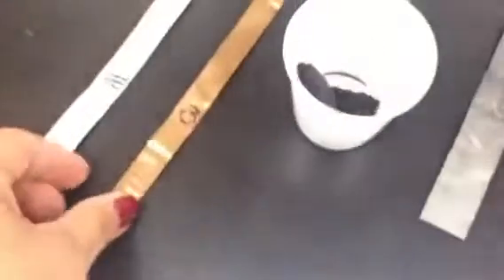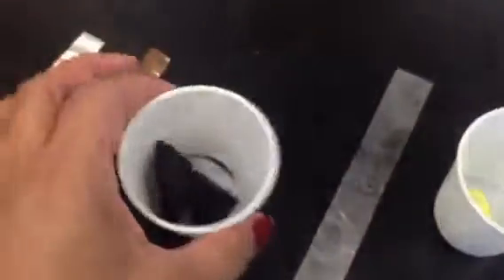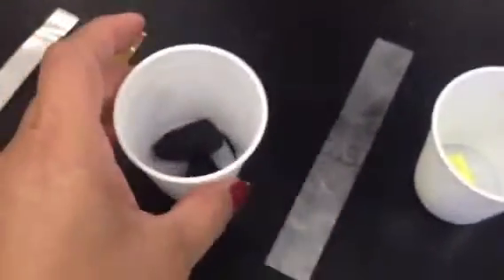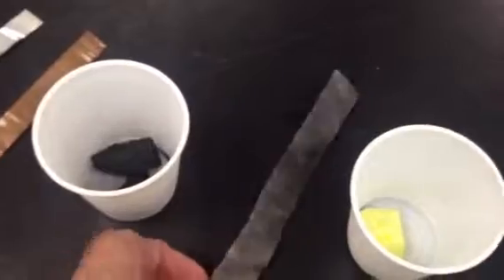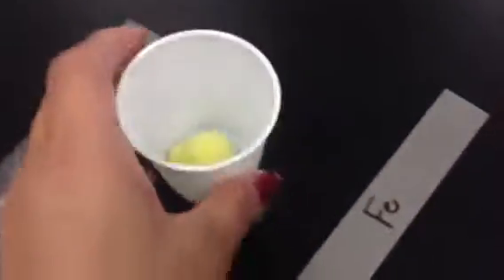The last one is malleability, test D. Notice copper is already hammered into a thin sheet. Write down your answer. If this were to be hammered, it would probably break. So write down your answer for that one. This is a thin sheet already, bendable. This sulfur would probably break very easily if you were to hammer that. Okay. This one, iron, has already been hammered into a thin sheet. So you should know the answer to that. And zinc as well has also been hammered into a thin sheet.